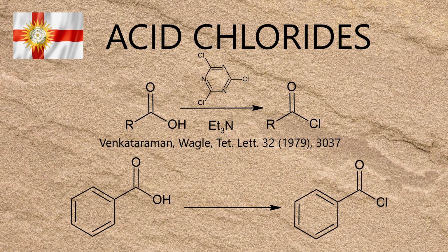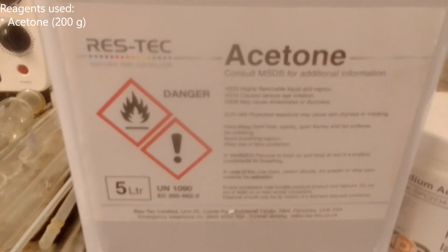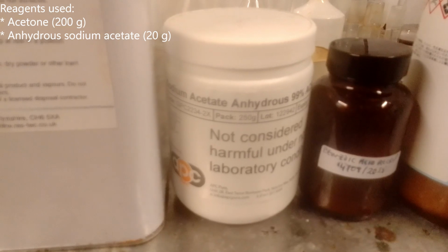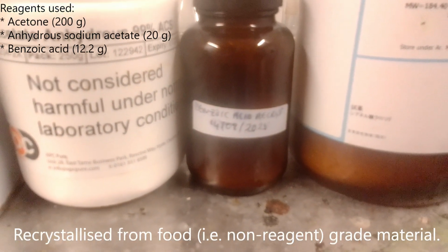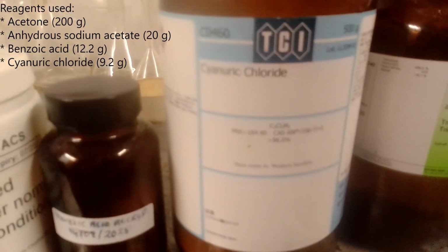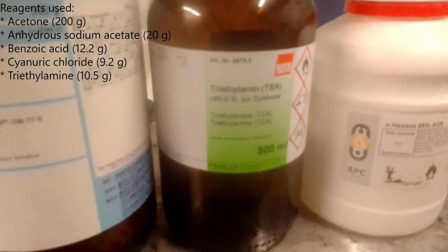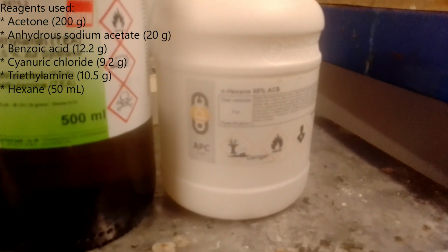In this video I used this method to convert benzoic acid to benzoyl chloride at a scale of 1/10 of a mole. The reagents used were 200 grams of acetone, 20 grams of anhydrous sodium acetate, 12.2 grams of benzoic acid, 9.2 grams of cyanuric chloride, 10.5 grams of triethylamine, 50 ml of hexane, and a special guest, 20 ml of dichloromethane.